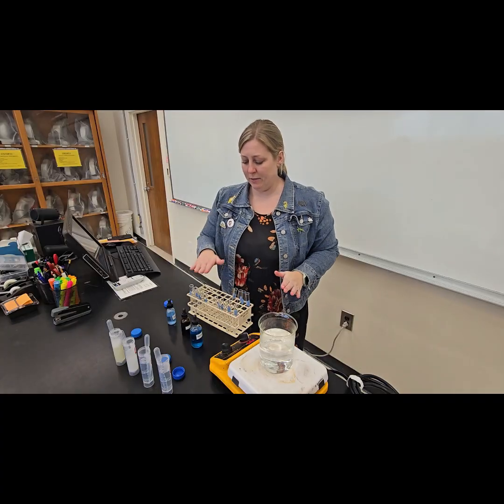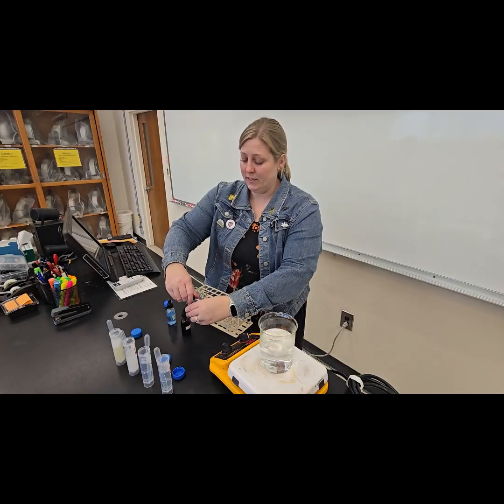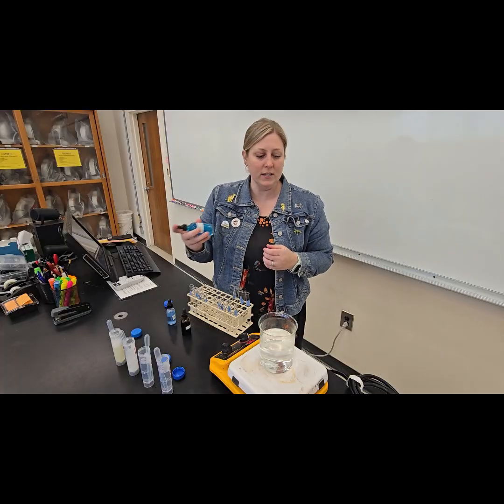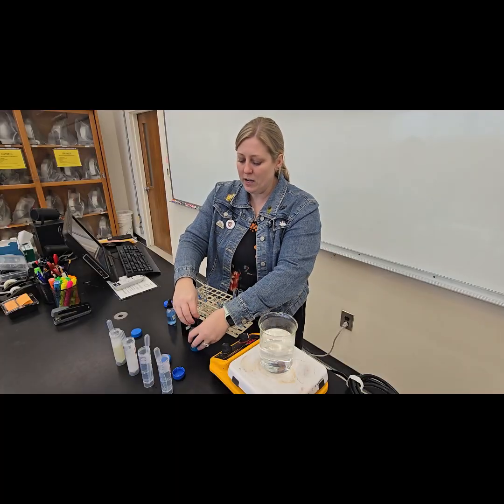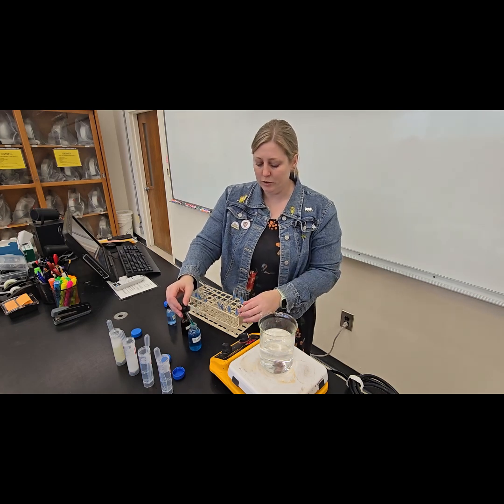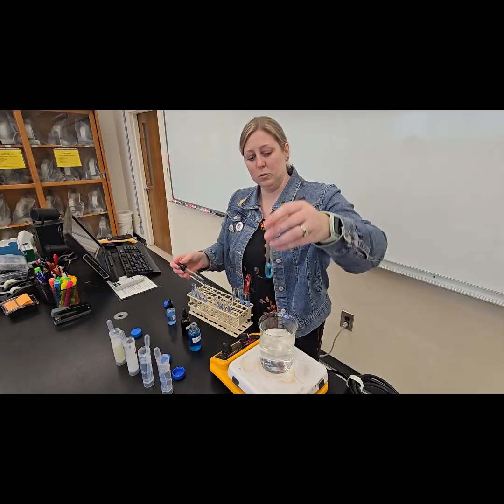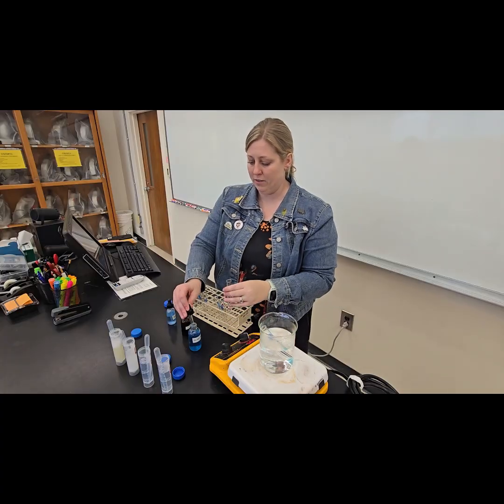All right, so I have added about 2 milliliters of solution to each of our test tubes, and I did that 3 times over because we're going to be running 3 different tests. For our first test, we're going to run what's called the Benedict's solution test, and this should turn colors in the presence of glucose once we heat up the solution. So we might get a really strong response to begin with like pure glucose, but generally we have to heat up the solution. So I am going to add just enough to make it a blue color, and this is distilled water. It should stay that blue color, and I'm going to put it into a warm water bath.